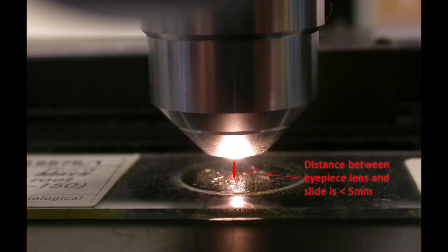This image should give you a starting point. In this case, looking at the slide micrometer, you should hopefully see at least part of the black ring as here. And because of the curve orientation, this must be the 3 o'clock guide. So the center of the ring is off to the left, so move the stage appropriately to find it.